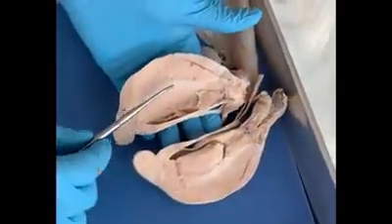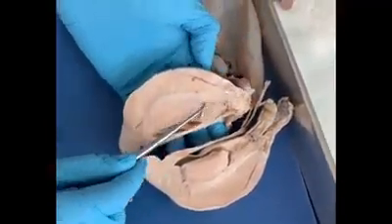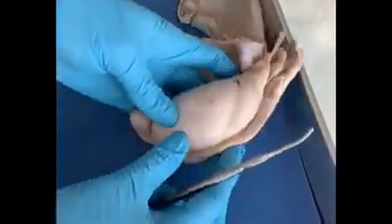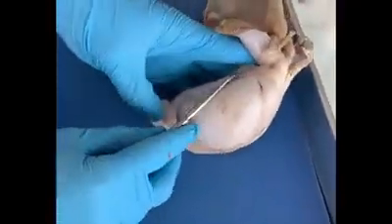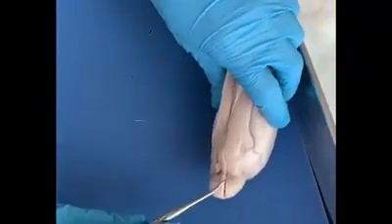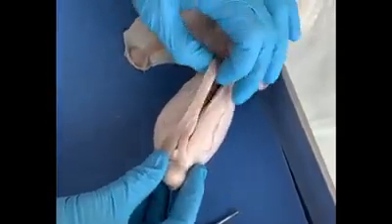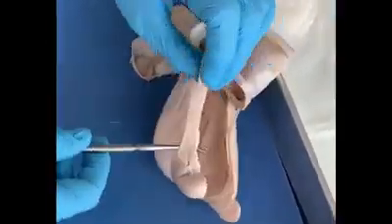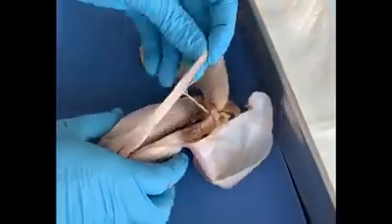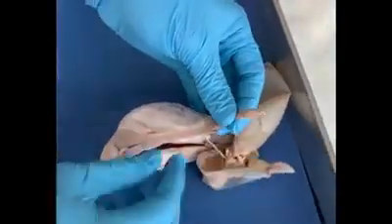The significance of this epididymis is that the immature sperm which are formed in the seminiferous tubules are going to travel up into the head of the epididymis, so this is the head of the epididymis, and they will travel down through the body of the epididymis and down to the tail all the way, tail of the epididymis. And if you notice, this tail of the epididymis is connected to another structure called the vas deferens, and that is going to be the duct which carries the sperm into the ejaculate. So this is going to lead all the way to the ejaculatory duct.